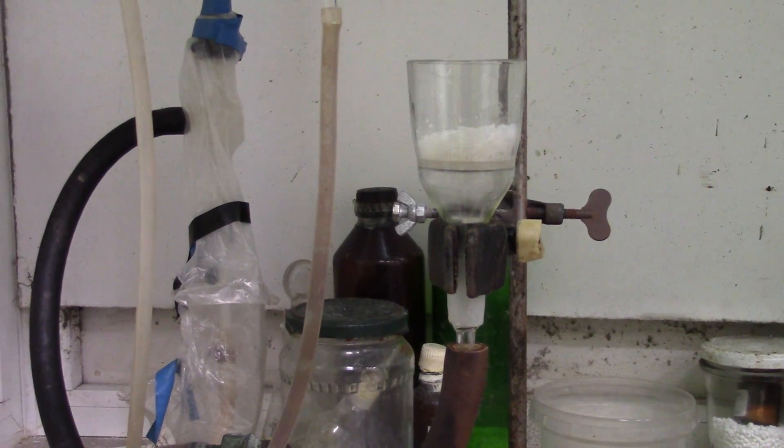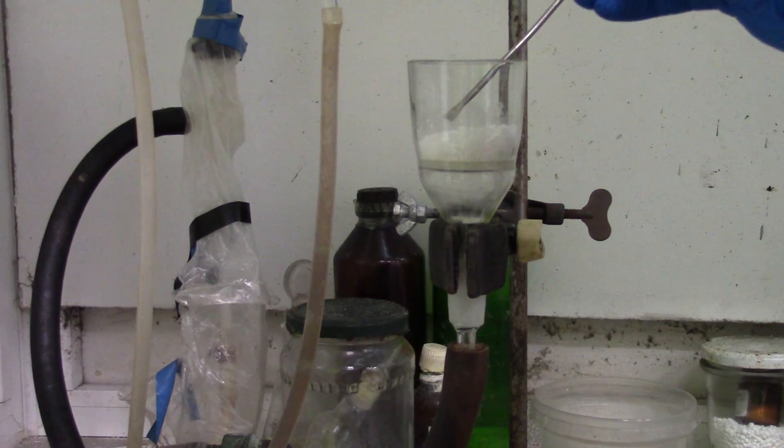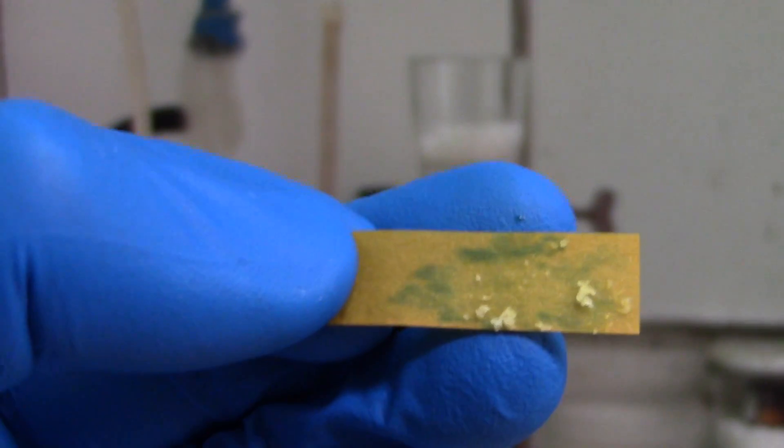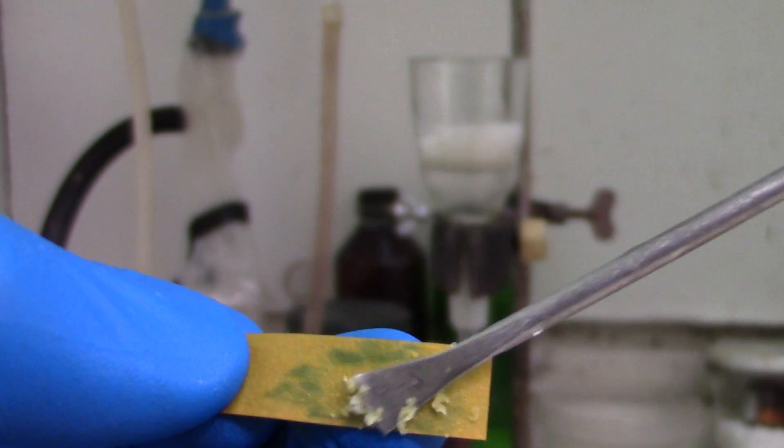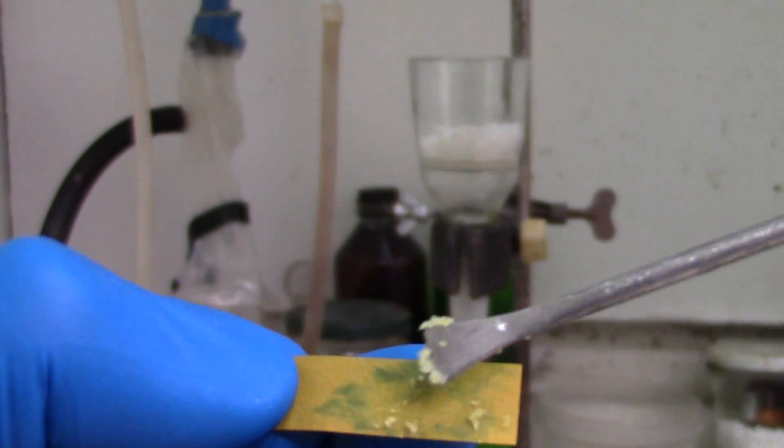While salt is drying under airflow, I decided to test the pH of it. And it's obviously basic in water, with pH about 8.0.